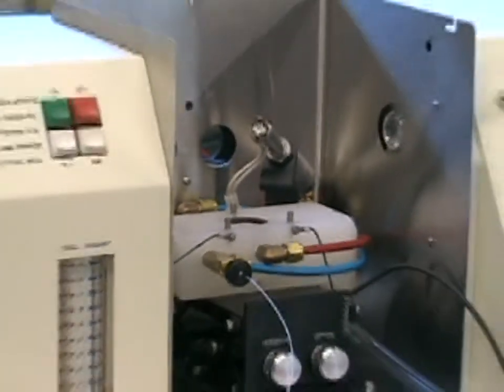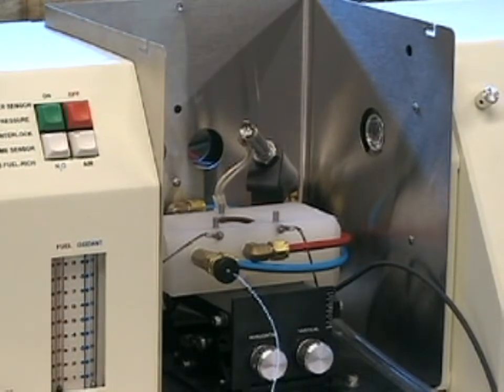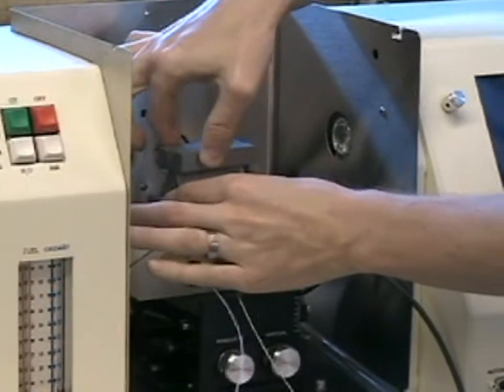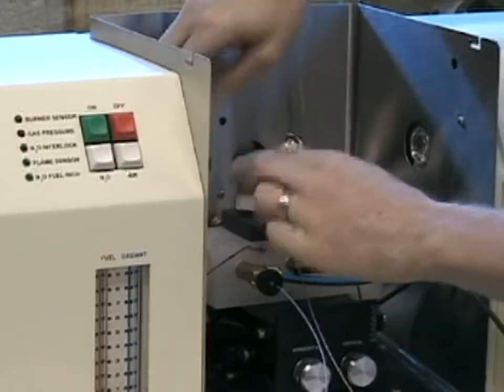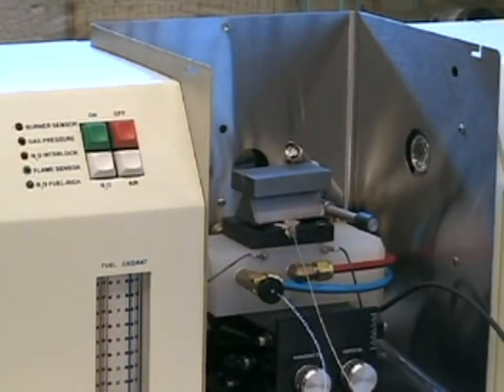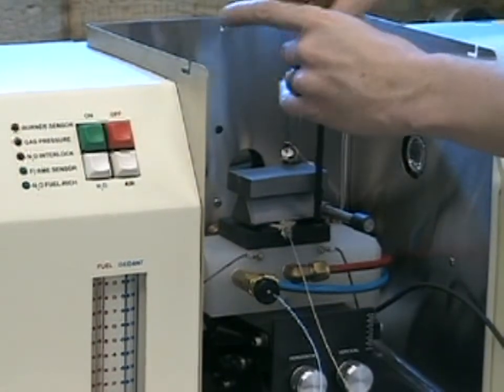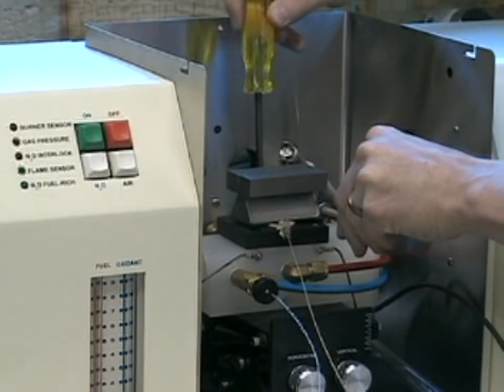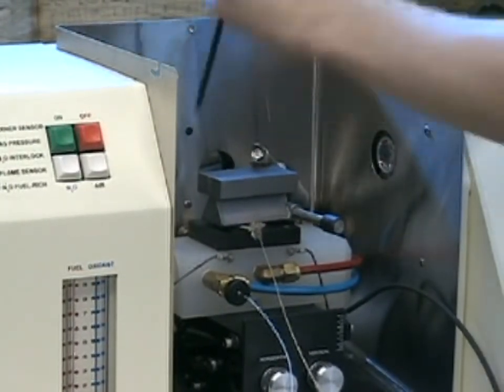The nitrous oxide burner will have a collar that will also connect to the spray chamber, and as you can see, when it's properly inserted, the round collar should lay flat against that O-ring. Use the hex wrench to tighten down on the collar to secure it to the spray chamber head.